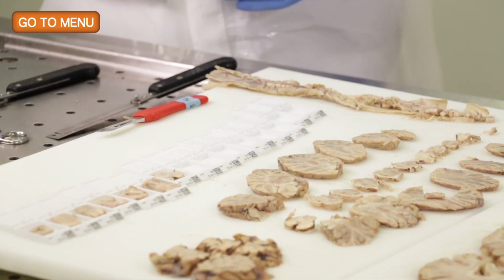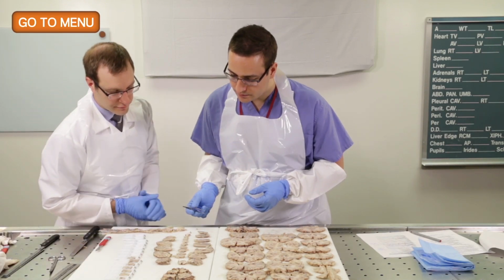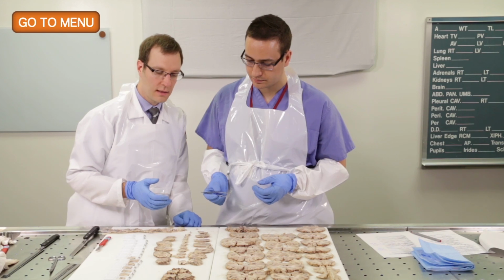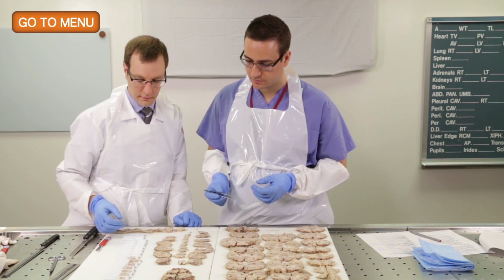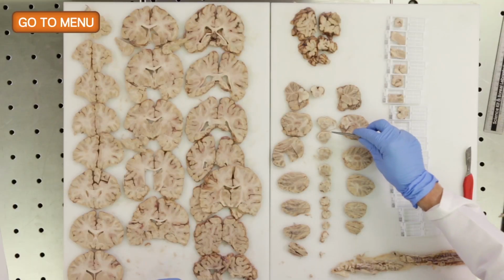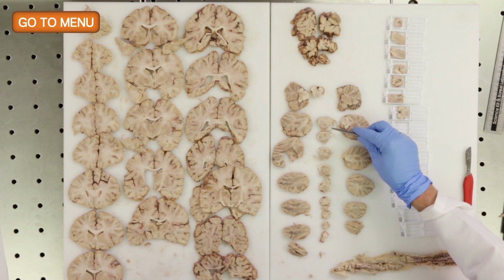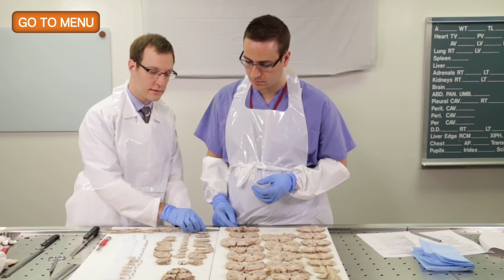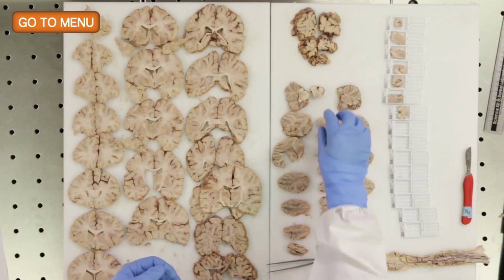Great. So now let's take a section of the pons. What you want to shoot for when you take your section of the pons is to make sure that you're getting the locus ceruleus, which are these pigmented nuclei here in the dorsal aspect of this region of the brainstem. They're important in neurodegenerative cases, so we always target the locus ceruleus as part of our pontine section.